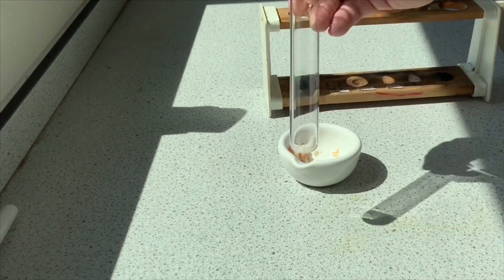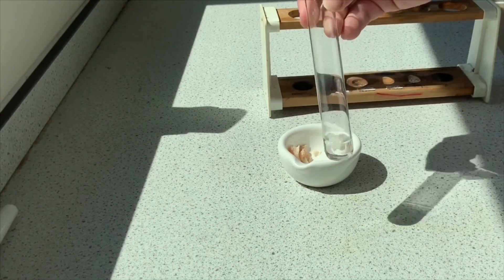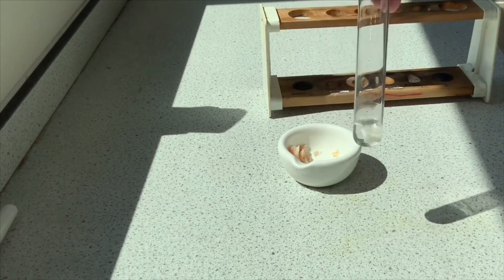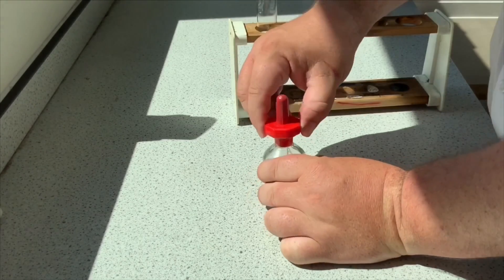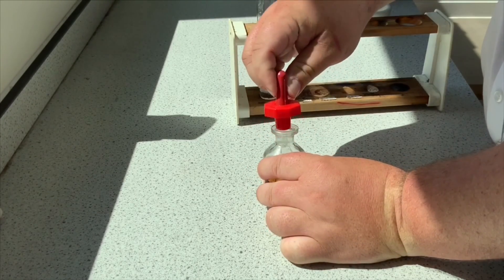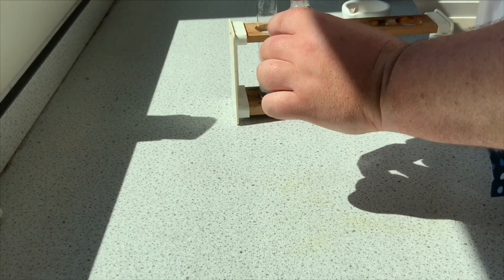To drop it in, and then the idea is I want to stick just a little bit of distilled water inside that. Now what I want to do is get my ethanol. You'll notice it says highly flammable on the label - the exam board is keen that you notice that. So I put a few drops of ethanol inside.